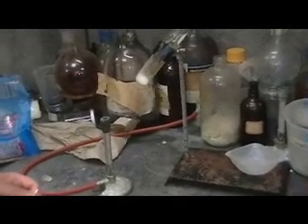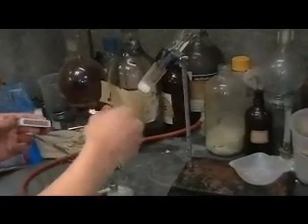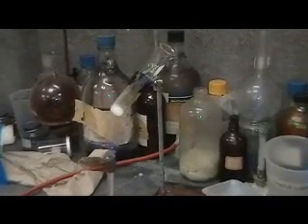Be sure to turn on the fume hood to absorb any gases that will be produced from the combustion reaction. After lighting a Bunsen burner, decompose the solid until it melts completely. Be sure that all of the solid has melted completely.